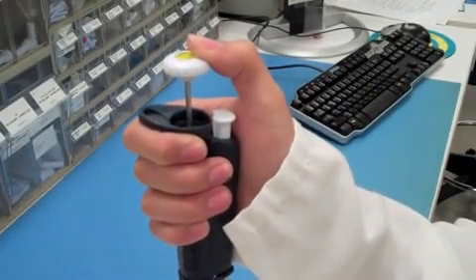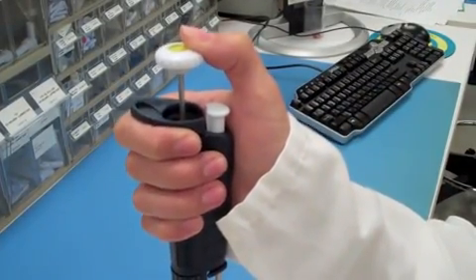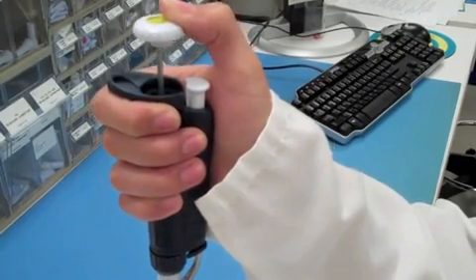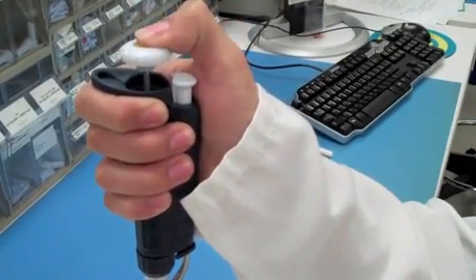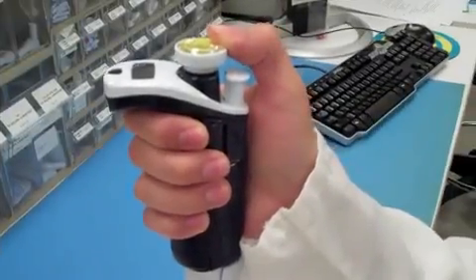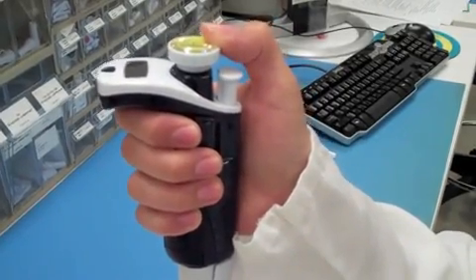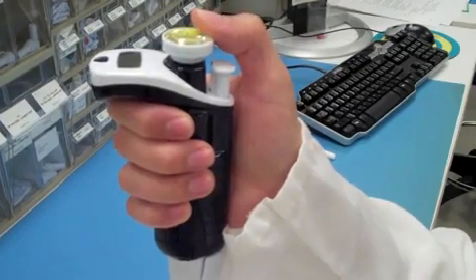Many of you are used to using the P-series Pipetman. These pipettes rely on the movement of your thumb to control the piston. Since the Pipetman M is motorized, there are virtually zero pipetting forces, and to aspirate and dispense, you simply click the button.